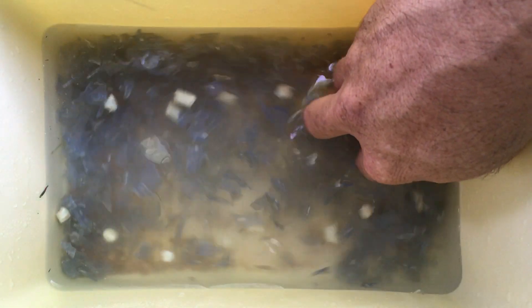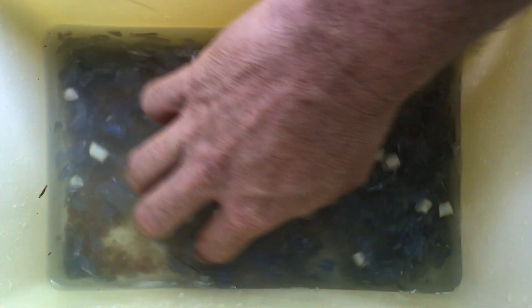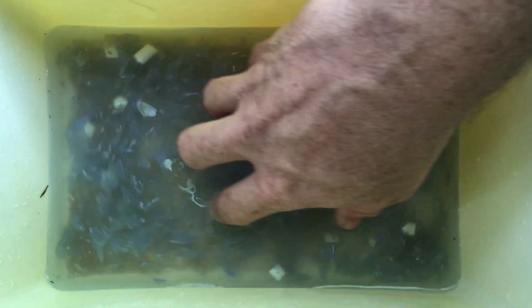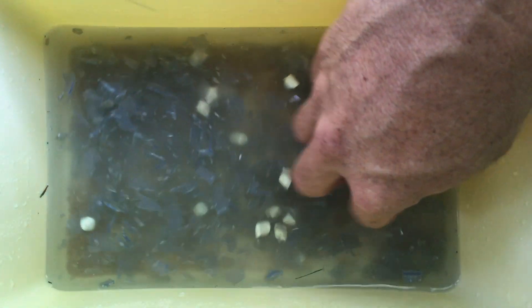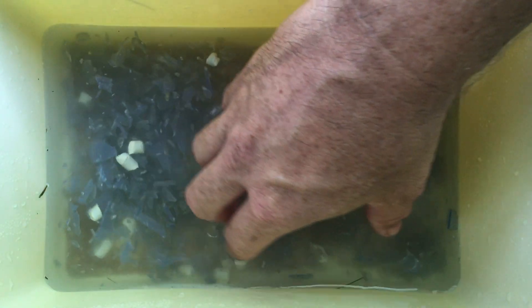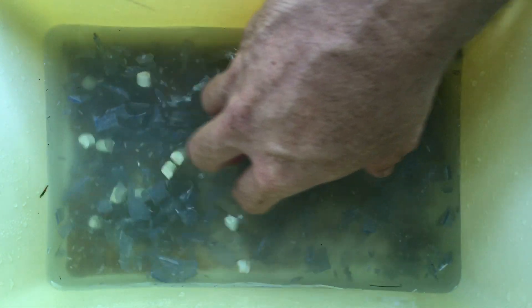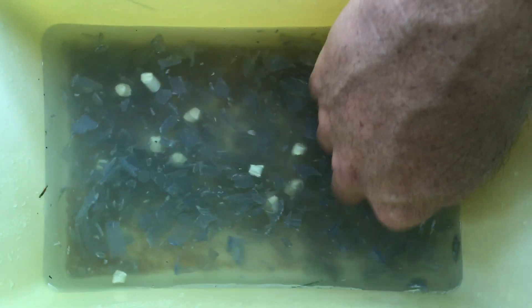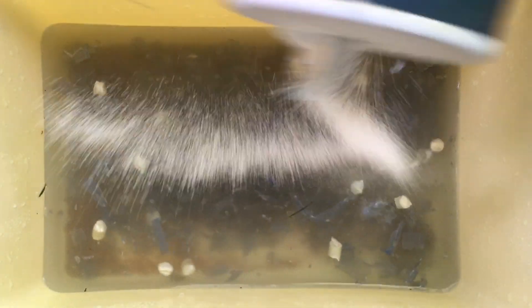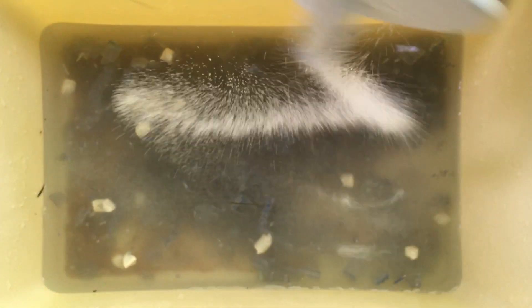As the water becomes more dense, the polystyrene pieces, which are not changing in density, will become less dense than the water, so they'll float. And the sand, which doesn't change its density, is still more dense than the water, so it sinks.